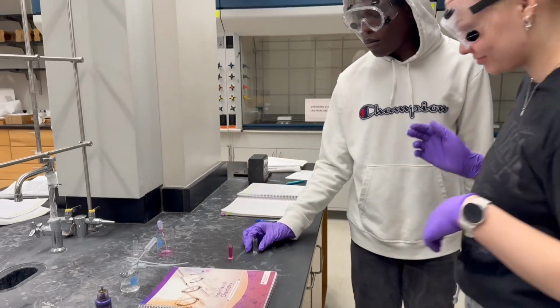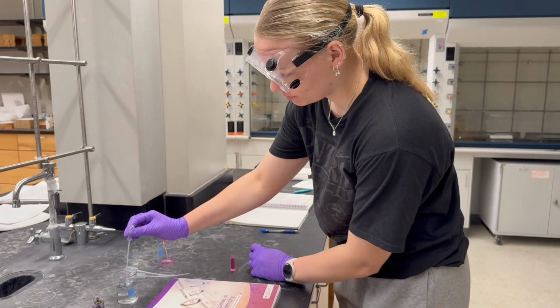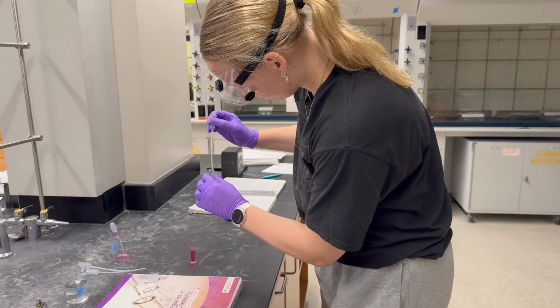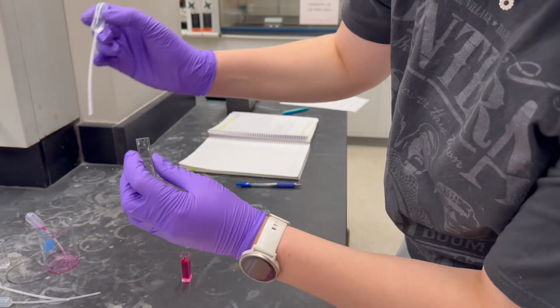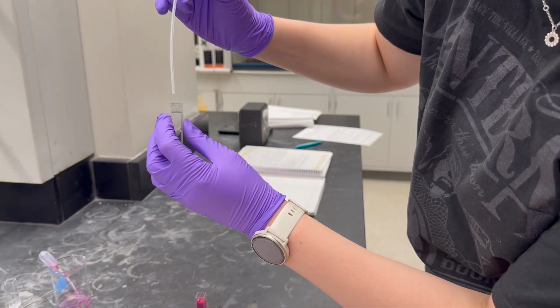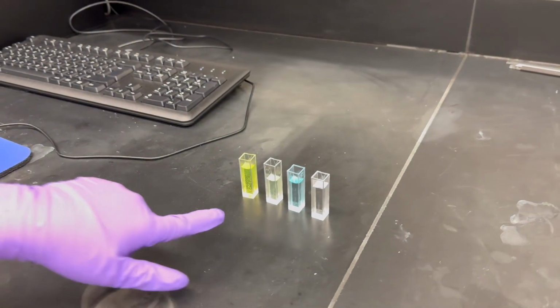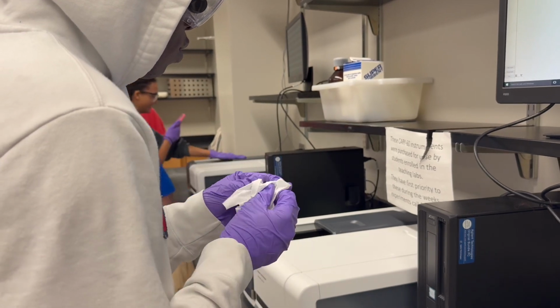We had to make sure that the wavelength had the right scans, because if it's wrong, it will give us a whole different solution. The lambda max is also what we needed from the wavelength, because it gives us the maximum of light, or the crucial parameter for identifying, which we need to identify what the substance is.